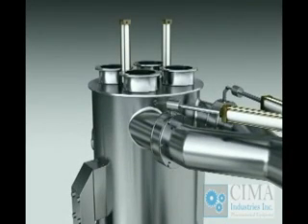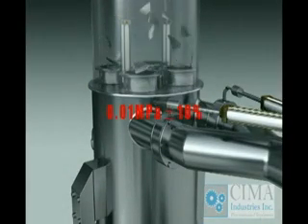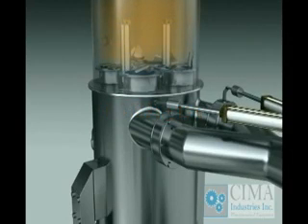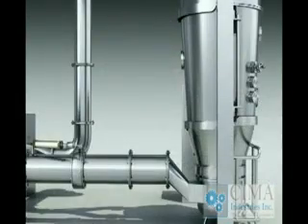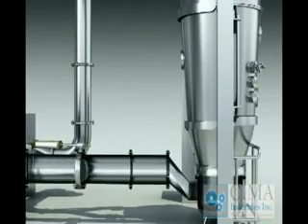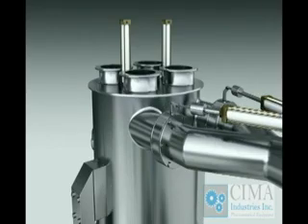Rupture discs are supplied on the top of the main machine for explosion-proof type. They will burst at a pressure of 0.01 MPa plus or minus 10% automatically, and then the air will be released to the area specified so as to protect the operator. The automatic valves on the air inlet and exhaust ducts will also close automatically so as to protect the air inlet handler and the exhaust fan and filter.